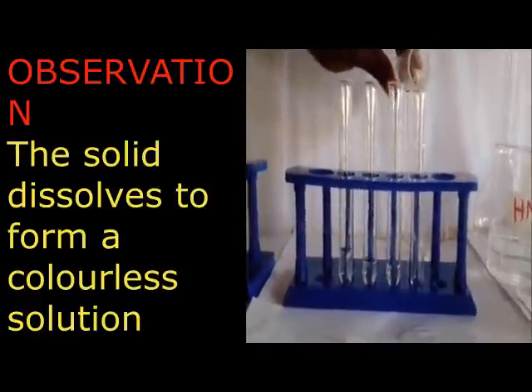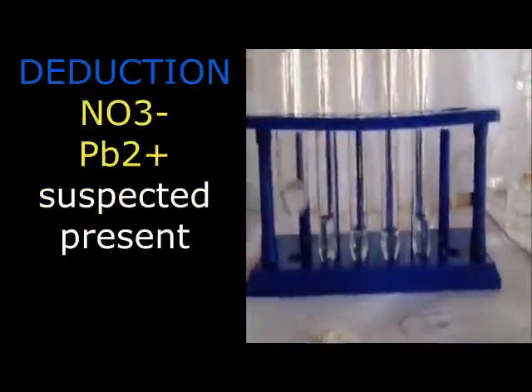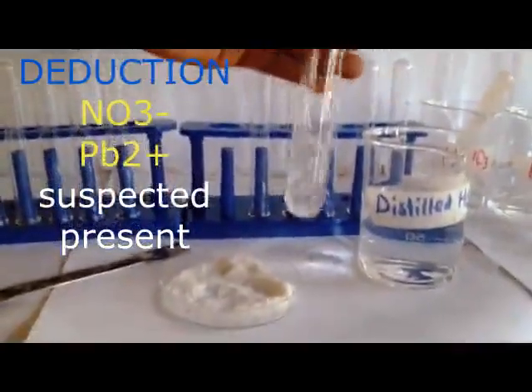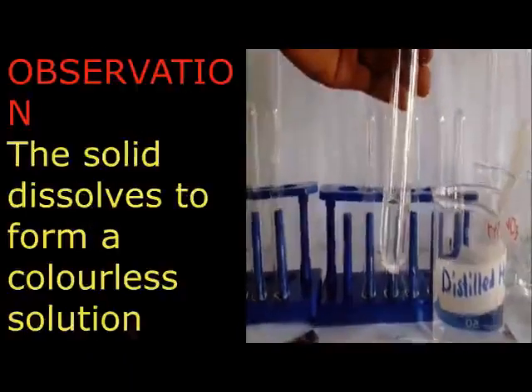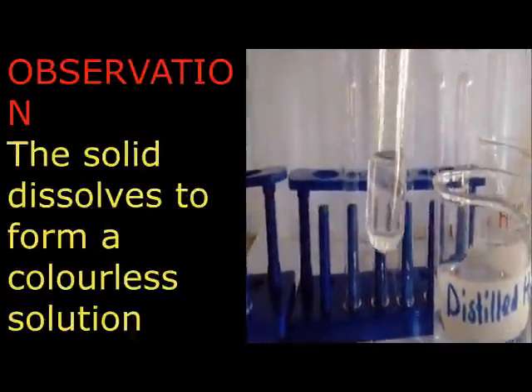We said nitrates are soluble. So there we say nitrate suspected. Then because of the formation of a colorless solution, we are going to bring back our cation there, lead. Now don't bring all the others which you mentioned at the beginning: calcium, magnesium, zinc, what?